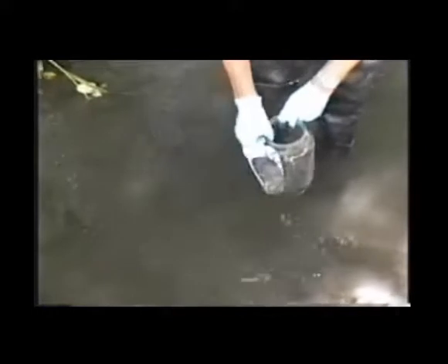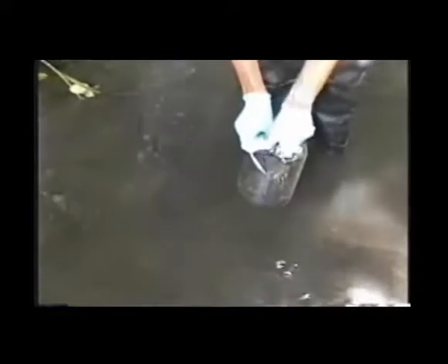I'll pull out any large twigs or branches or leaves.